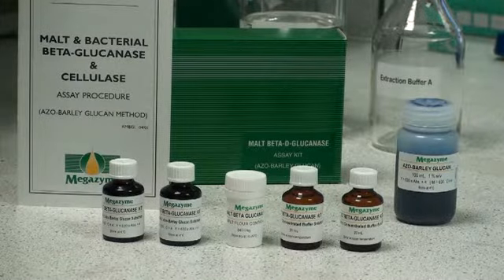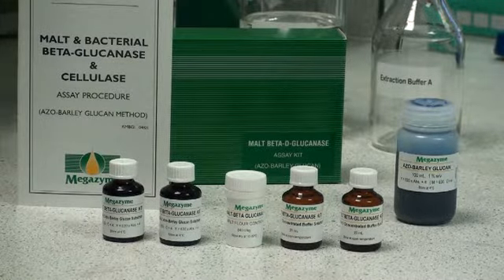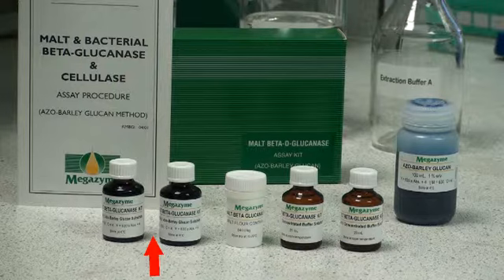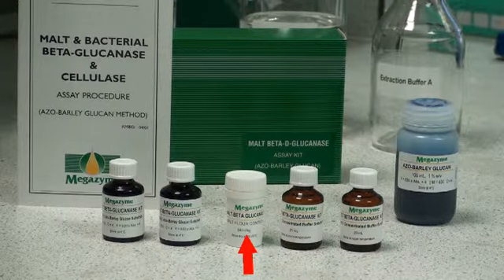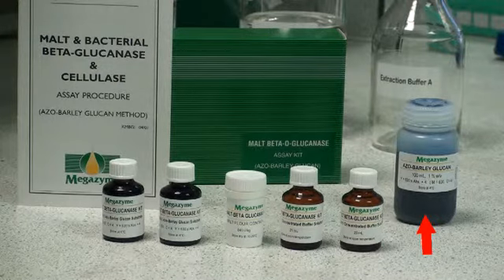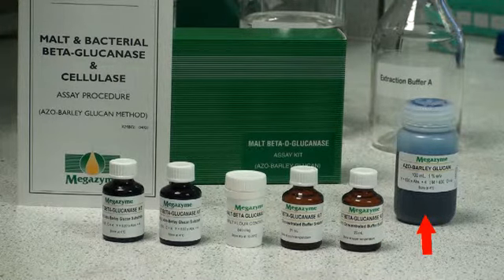The malt and bacterial beta-glucanase kit, as received, contains a booklet with the full assay method, two vials of azo-barley-glucan substrate, a vial containing malt-flour control, and two vials of concentrated buffer solution. The azo-barley-glucan solution can be purchased separately in 100 ml vials.